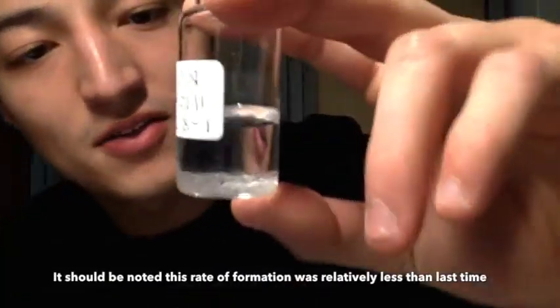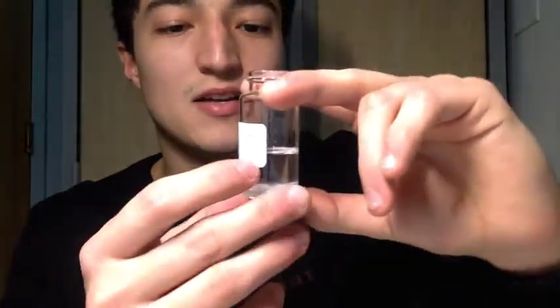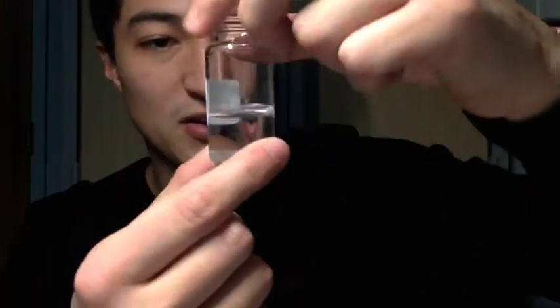It should be noted that the solution volume has decreased, and that is because as the solution evaporates, we see more crystal growth. So it's natural that the solution level would be lower as the number of crystals increases.